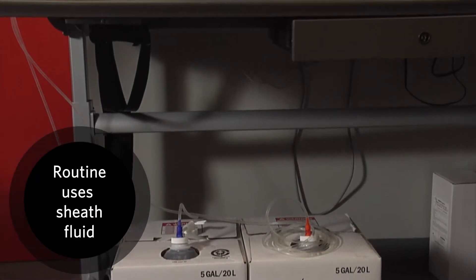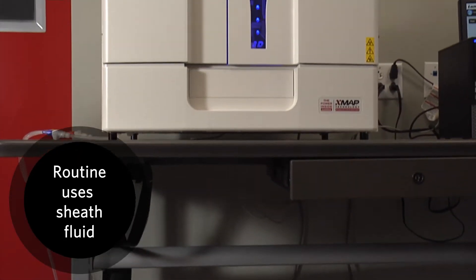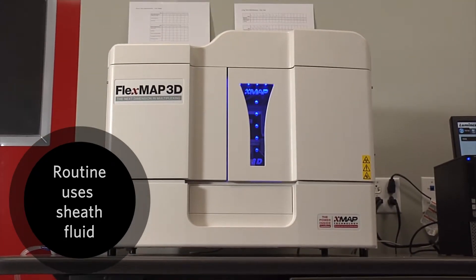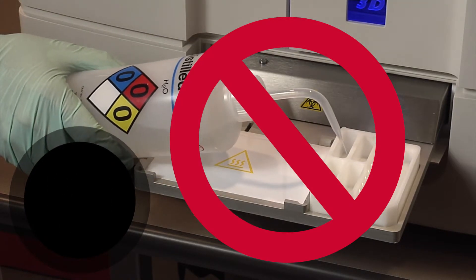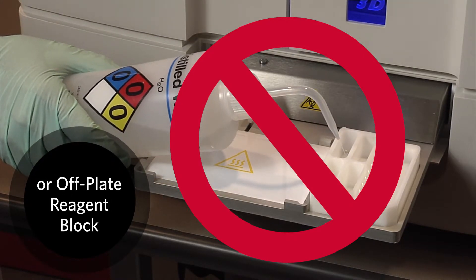Note, the FlexMap 3D instrument draws sheath fluid from the sheath fluid container for this routine. For this reason, no solution needs to be added to the plate or off-plate reagent block for this procedure.